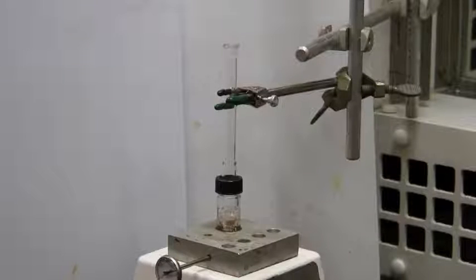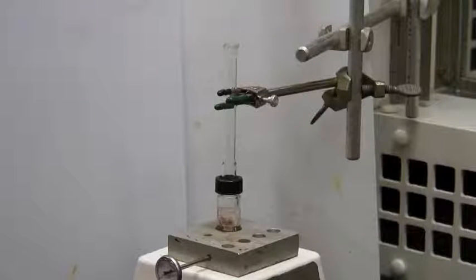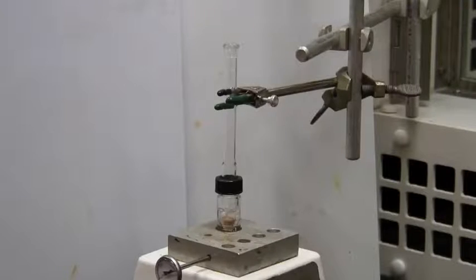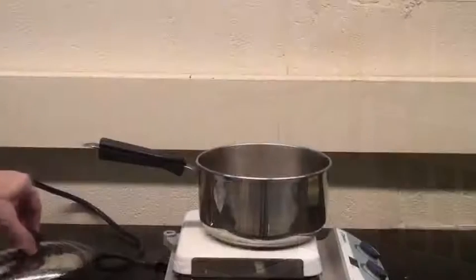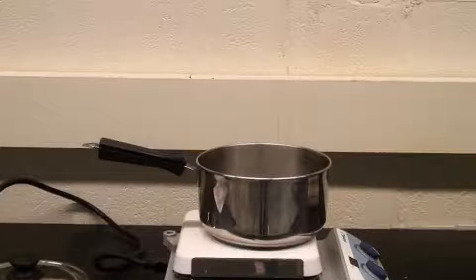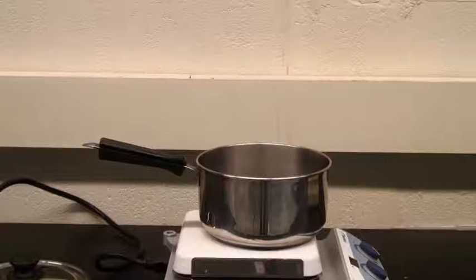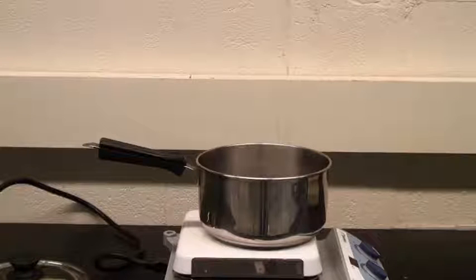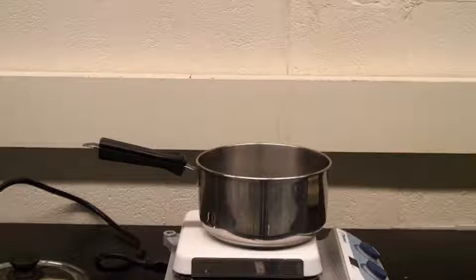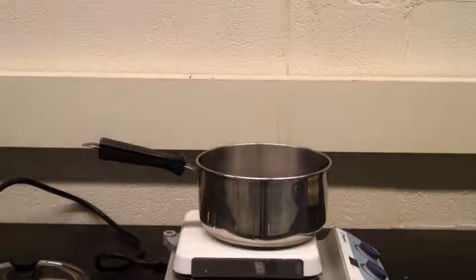The easiest way to get a system to a controlled higher temperature and keep it there is to use the boiling point of a liquid. Humans have been doing this for centuries — we prepare food by putting it in water and boiling it, which keeps the food at 100°C, the boiling point of water.